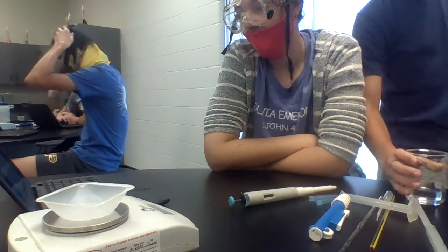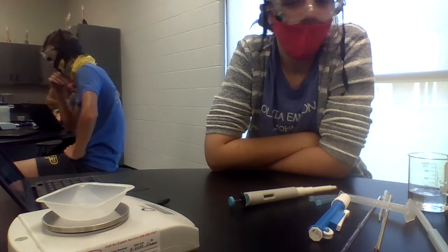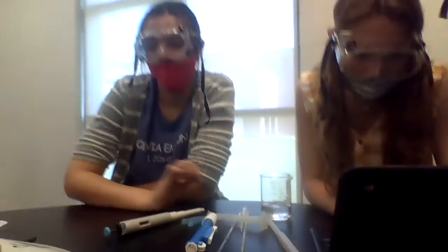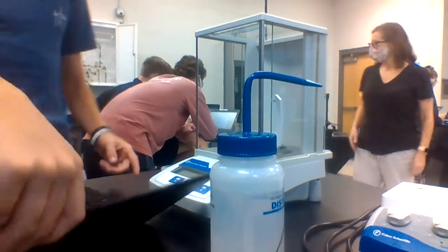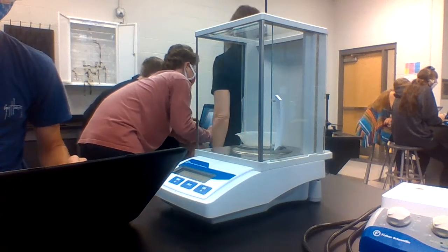If you put that, that's way too much. No, it's not. We have to do it again. It says measure another. No, I do mine in here, correct? Oh, no, no, no. Daniela, it changed. Just change it. The number's not saying. I got 129. That's pretty good. Let's just put 127.